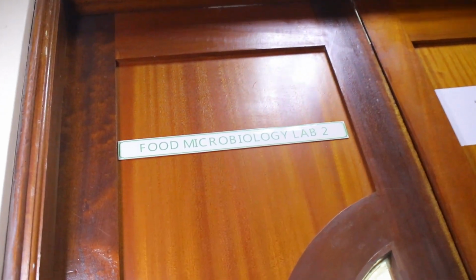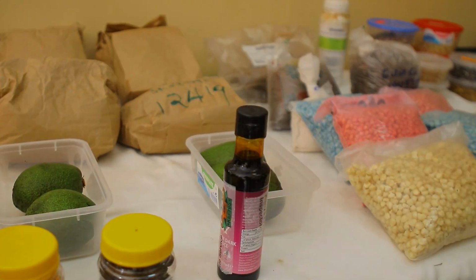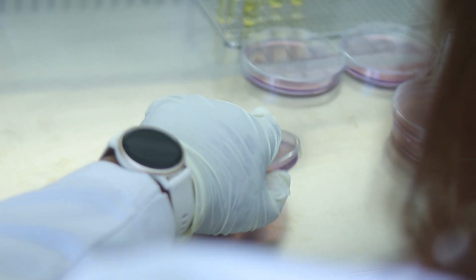My name is Patience Minor, Principal Laboratory Analyst in the Food Microbiology Laboratory. We test for harmful microorganisms in food and food products such as fresh vegetables, dry vegetables, meat and meat products, milk and milk products, as well as water.